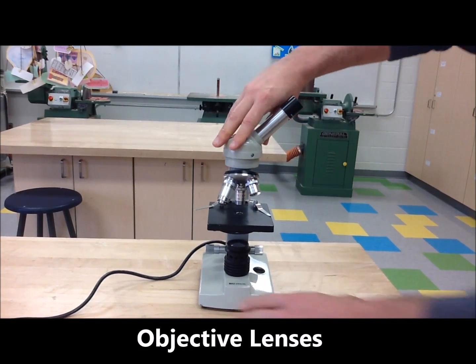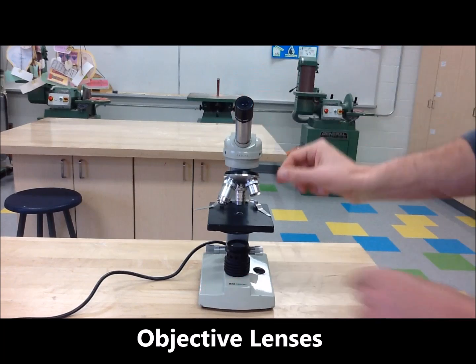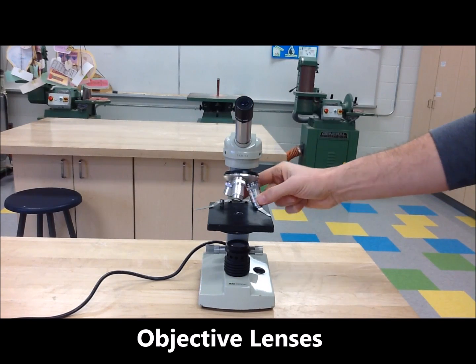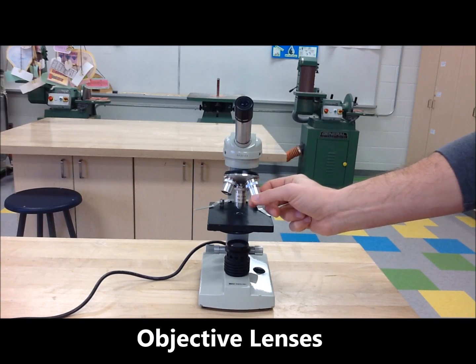Objective Lenses. Three different lenses that make the specimen even bigger in the image — either four times, ten times, or forty times bigger.